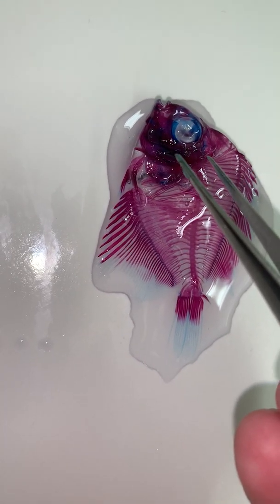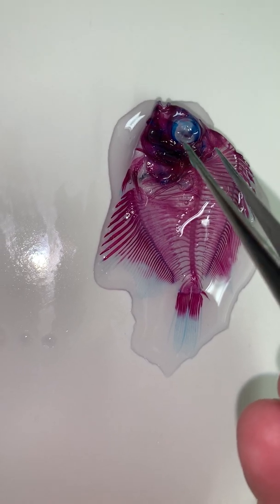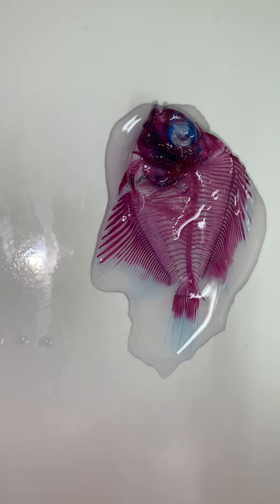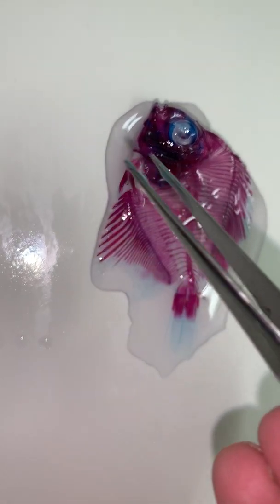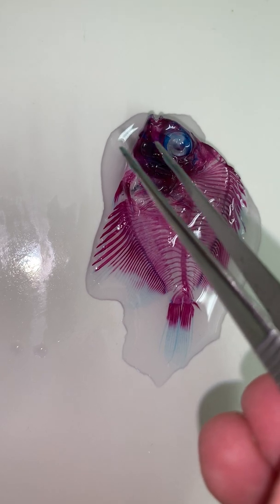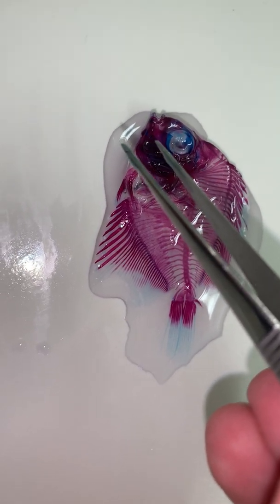So this is a fish that'll get about, you know, 6 inches in diameter. So this is just a baby. But we do see some blue in here. So that blue would indicate that those bones are endochondral. We can also look at the jaw here. And again, if you come into the lab and take a look at it, you'll be able to see that the back end of the jaw has some blue there.